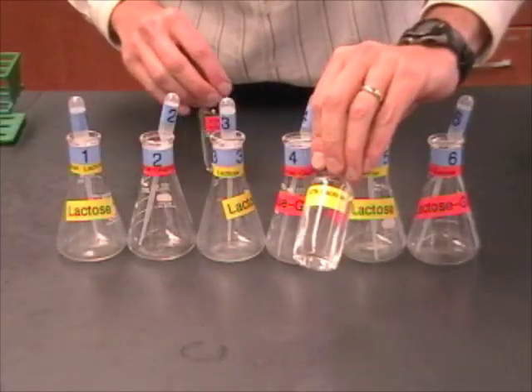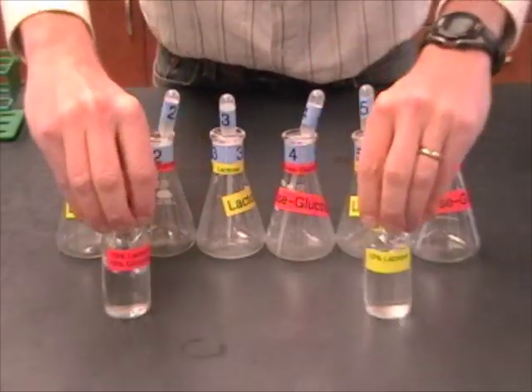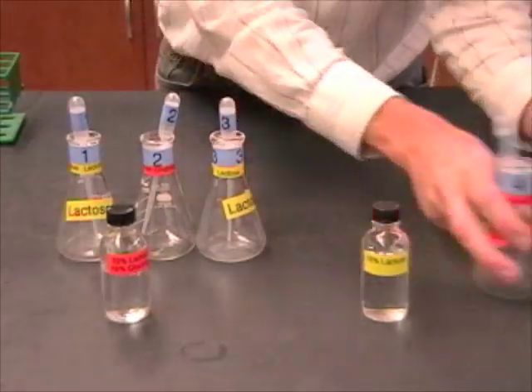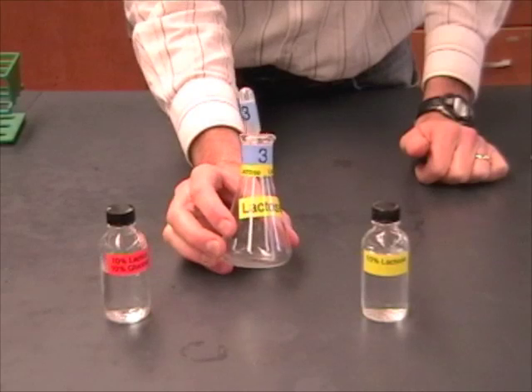You're either going to add lactose, and this is color coded also, or a mixture of lactose and glucose. Now, I'm just going to put the rest of these away and just keep number three out here because this is the one that I'm going to do.